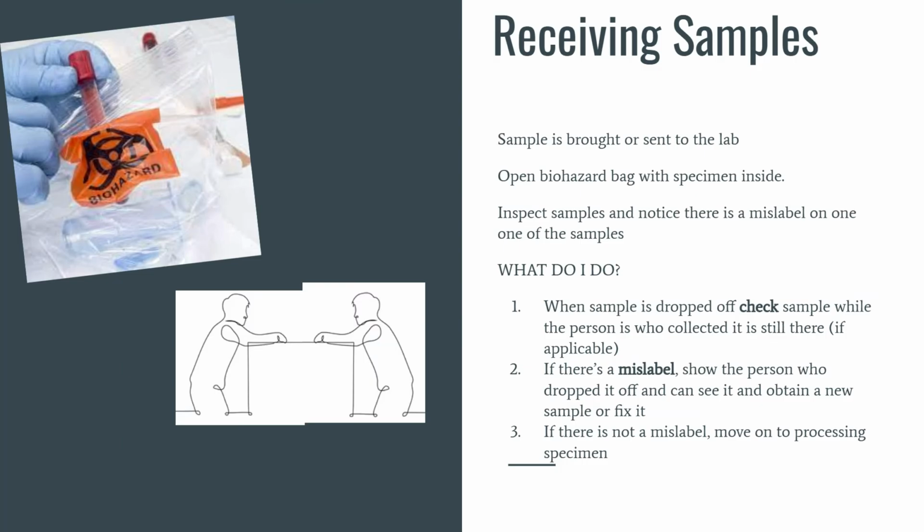So, when a sample is brought to the lab, make sure to check the sample while the person who collected it is still there. If there's a mislabel, have them look at it, see if they can read it and tell you what it is, or obtain a new sample. If there's not a mislabel, you can move on to processing the specimen.